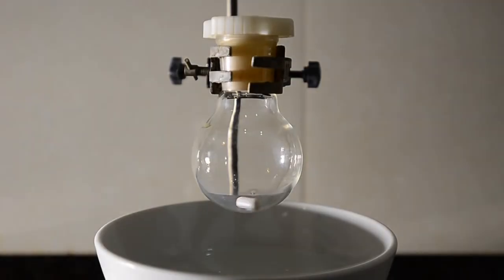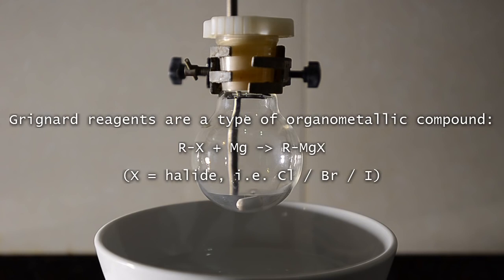Grignard reactions are famous for being highly water sensitive. We wanted to find out exactly how sensitive they are and if it was viable to perform them with the sort of dry conditions available to the amateur chemist.